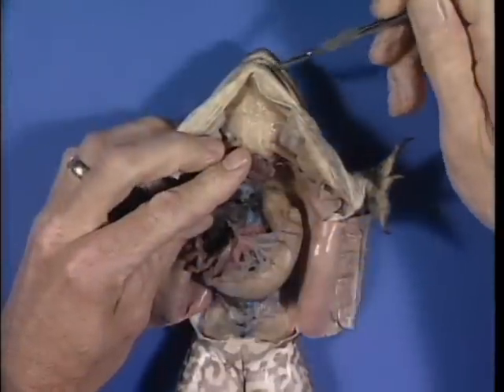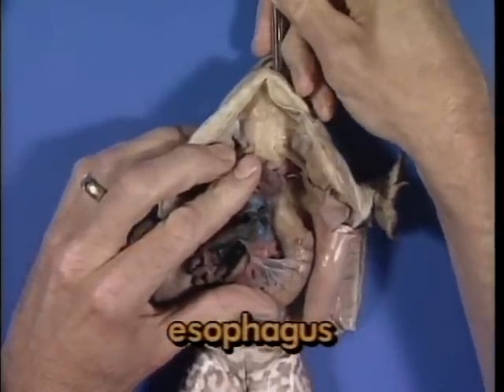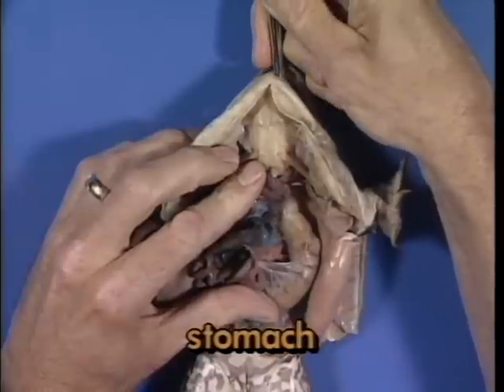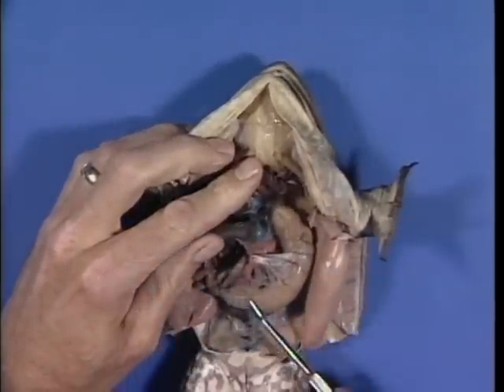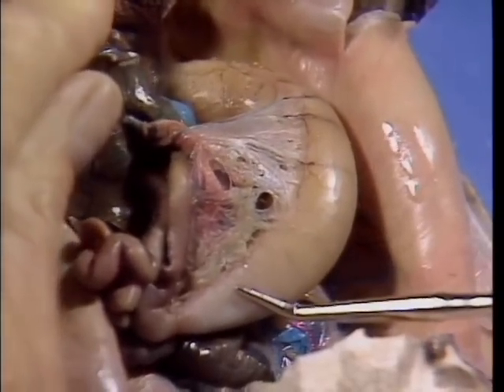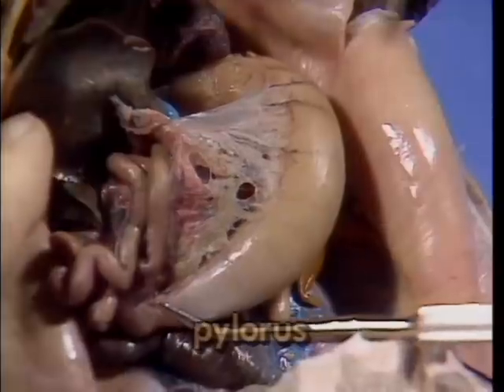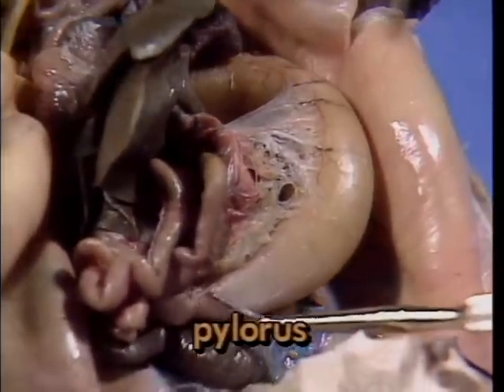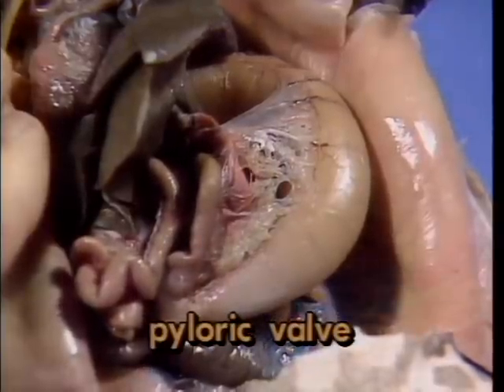Placing a blunt probe in the mouth verifies continuity with the esophagus, which carries food to the stomach. The primary function of the stomach is to store food prior to digestion in the intestine. The junction between stomach and intestine is marked by the pylorus of the stomach, a region which contains the pyloric valve.